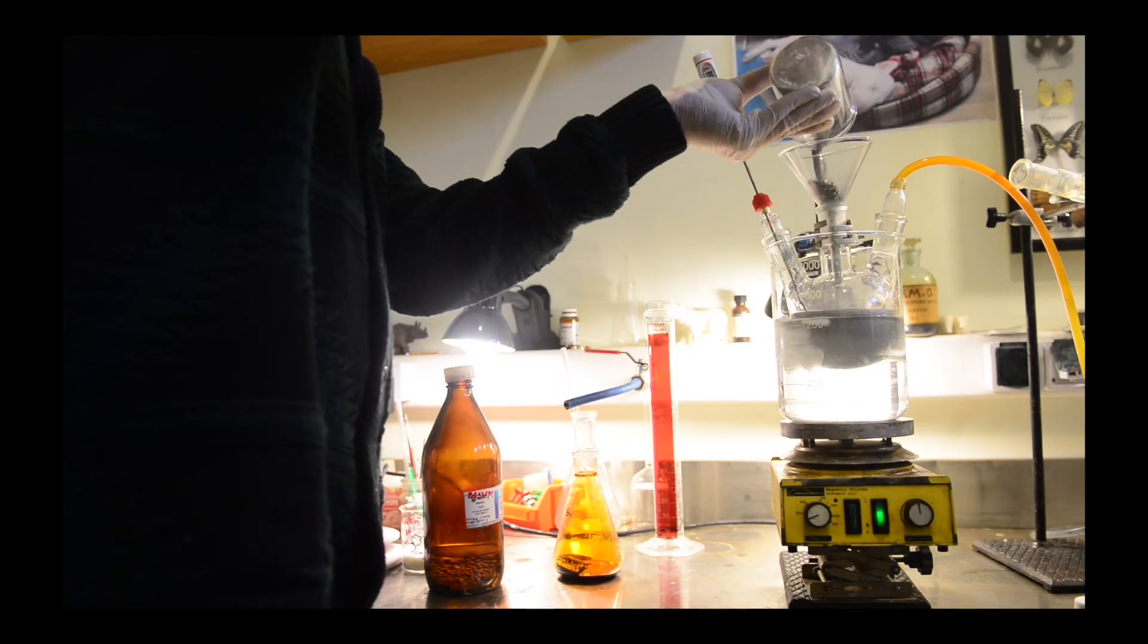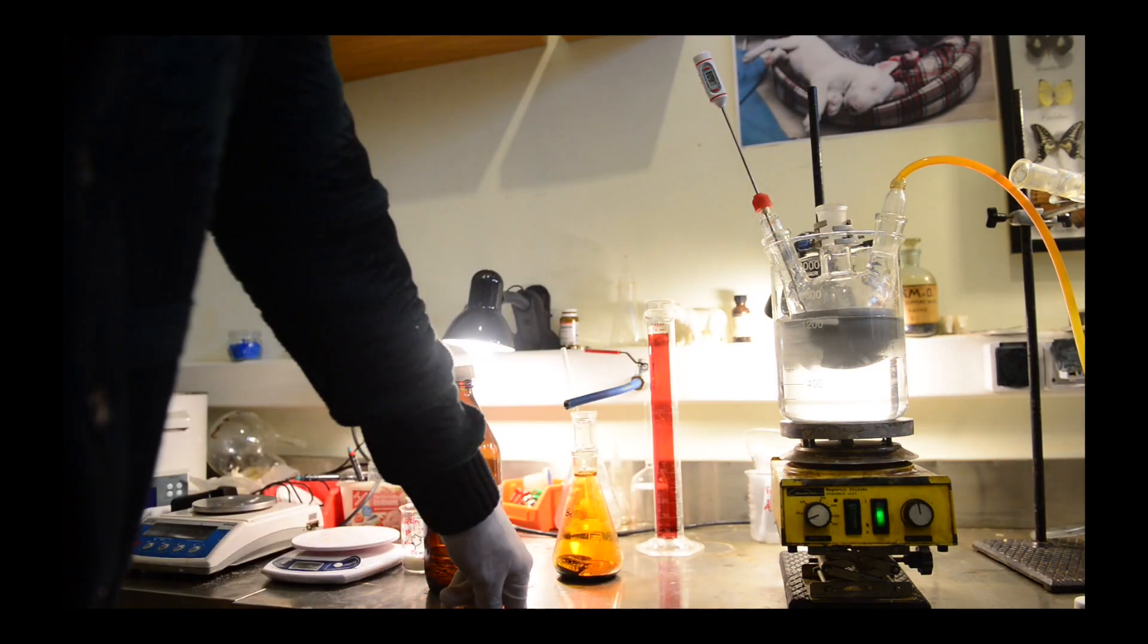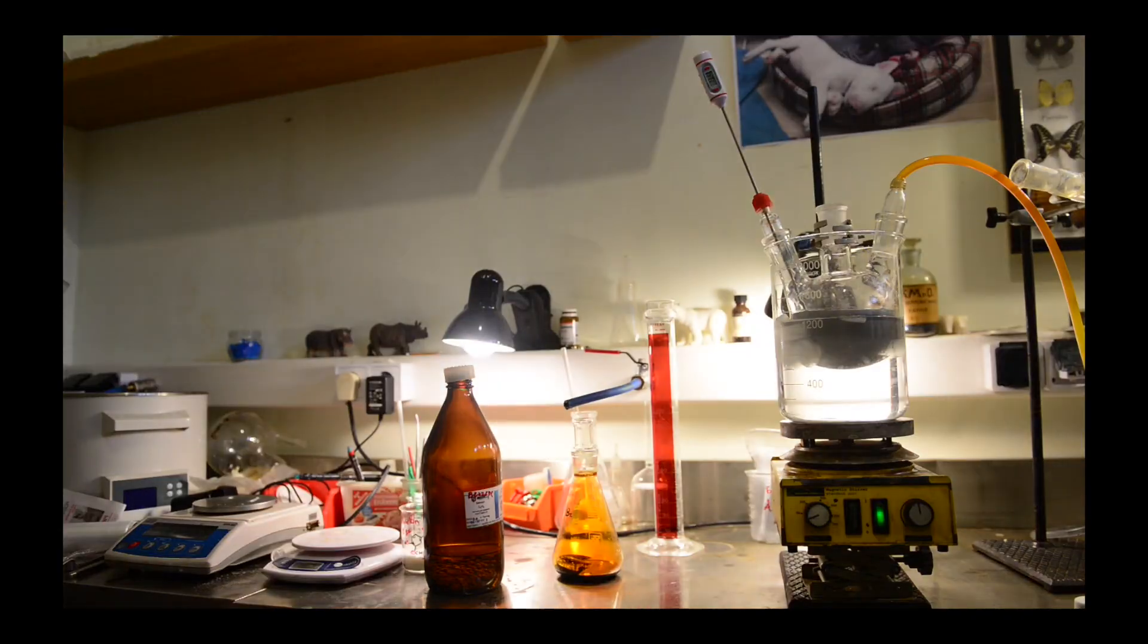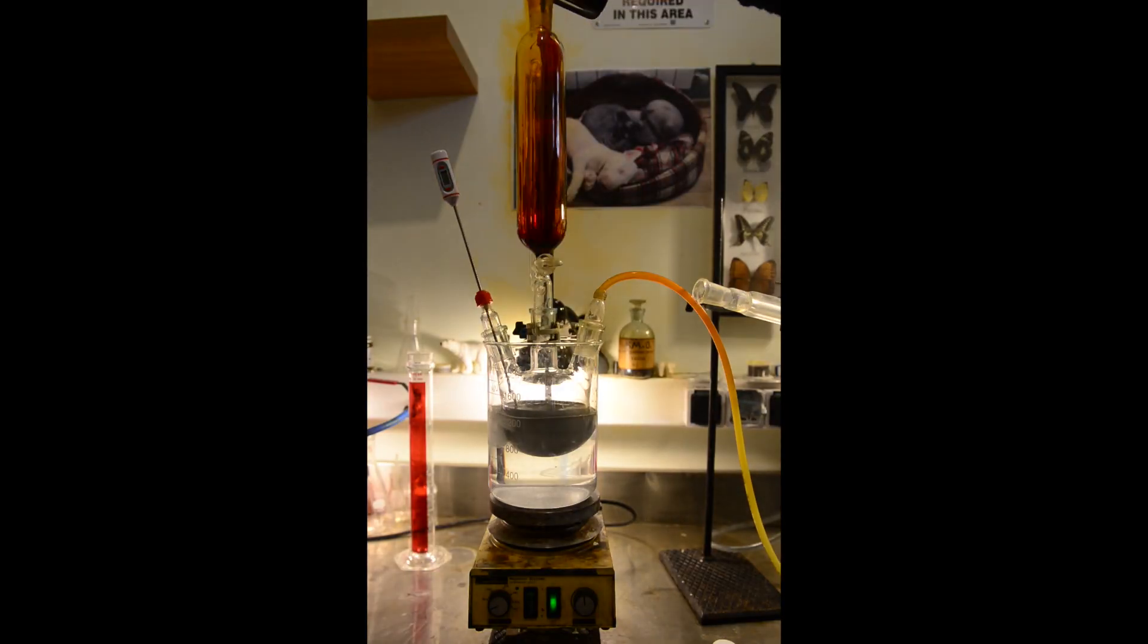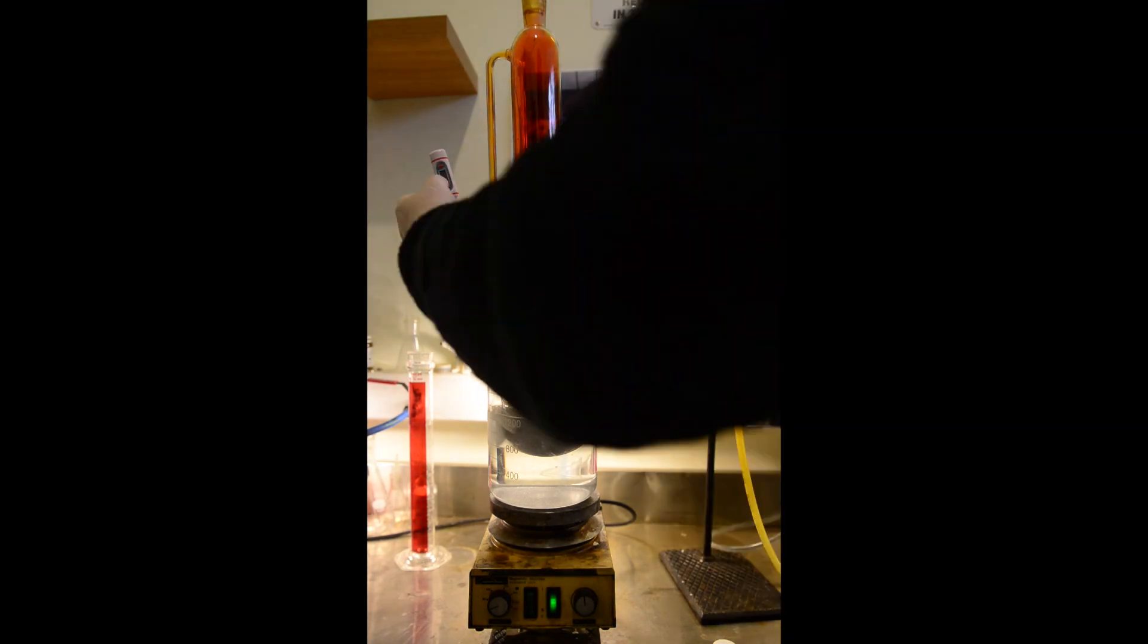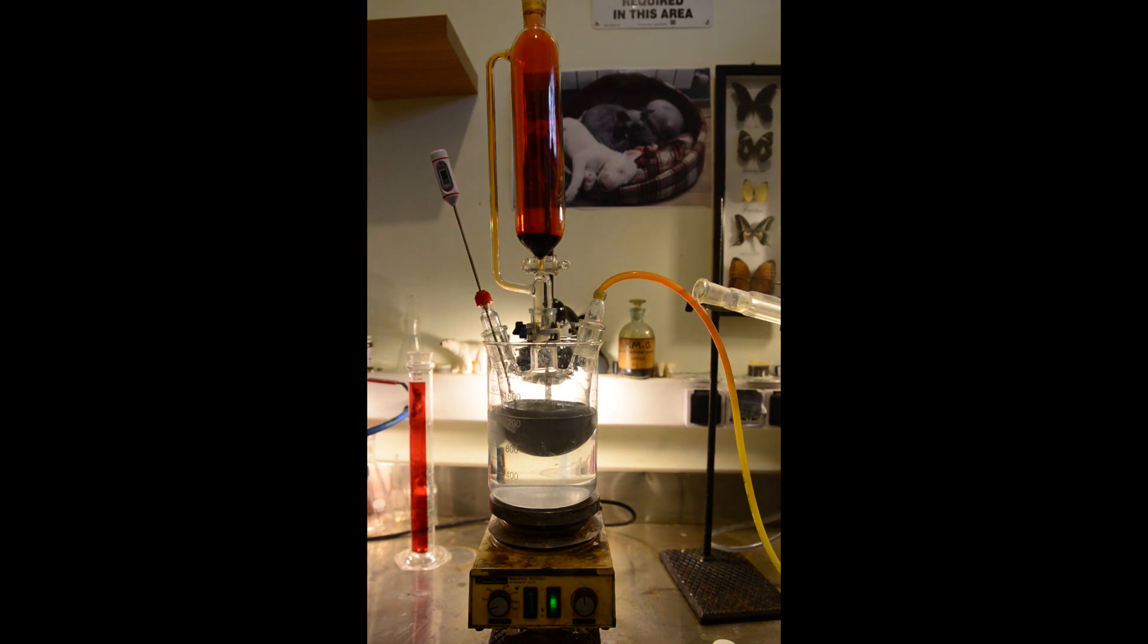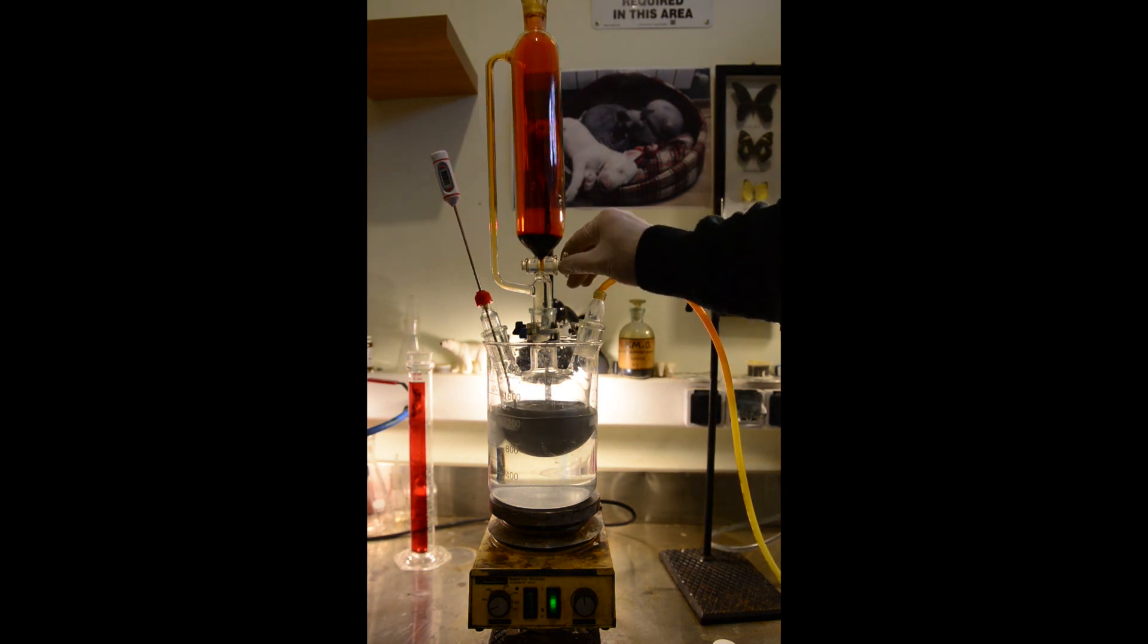This is the creepiest part of the reaction because adding bromine to the pyrophoric aluminum powder when suspended in benzene is not a game. You might have performed or have seen the reaction between aluminum and bromine followed by red fumes and ignited aluminum sparks flying in all directions. The benzene is the last thing you wish to have somewhere near there.